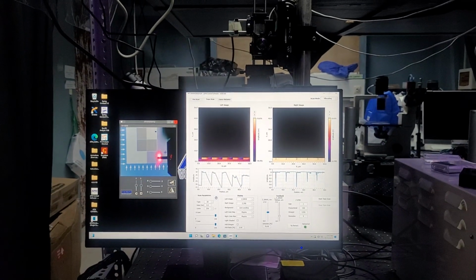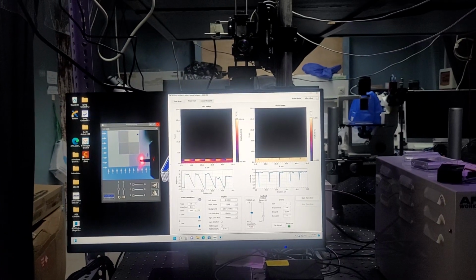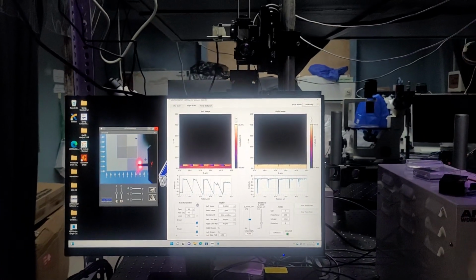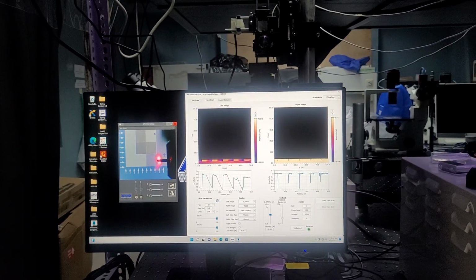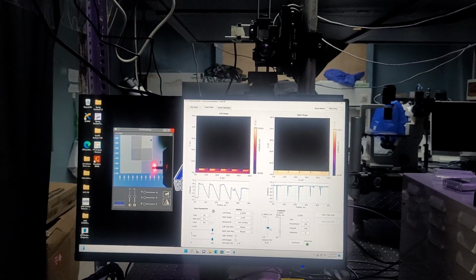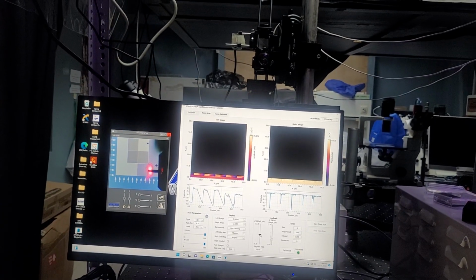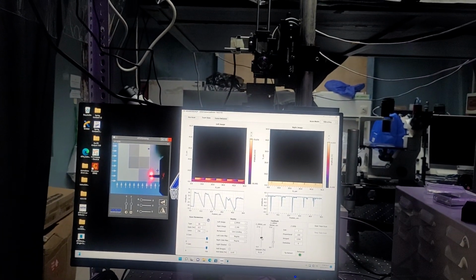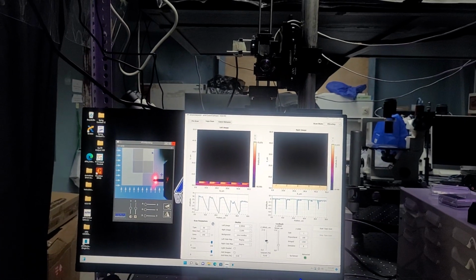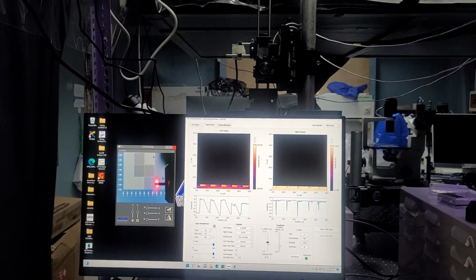Then we move on to the feedback. So we have a Z drive indicator, where 0 is showing when the Z piezo is fully retracted, 17 is showing whenever it is fully extended. And this blue indicator shows the actual position of its extension or retraction.